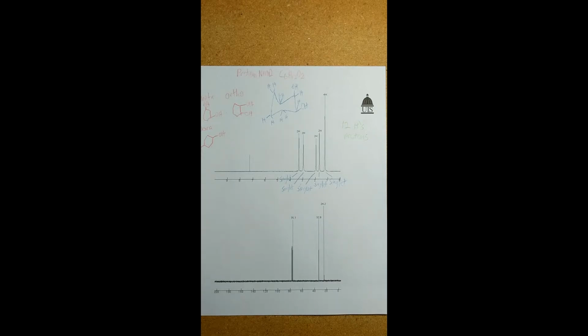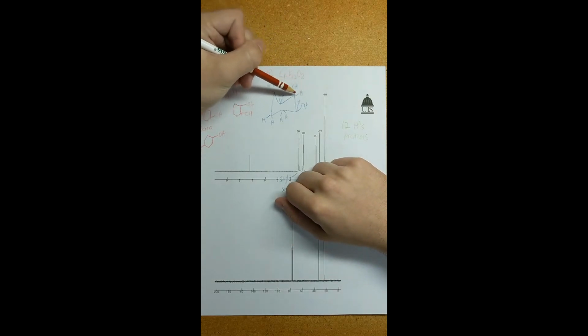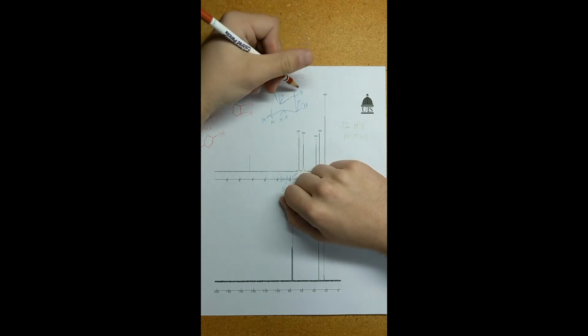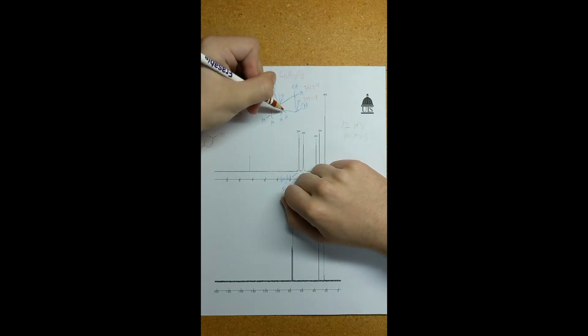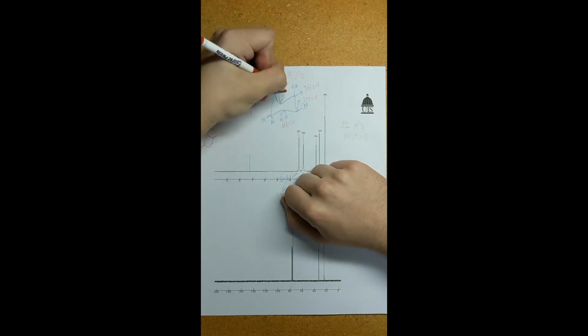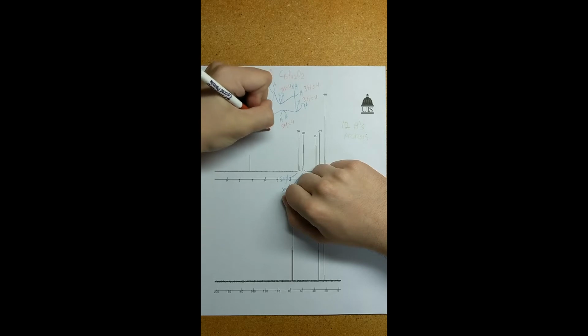So now that we have this, we're going to move on to the N+1 rule like I mentioned, in the hopes that it will help us line up with these integrations. It may not, but we will see. And to do that, referencing a proton, one looks at the adjacent carbons and its protons and takes that number +1. So for these two, they are both going to have an N+1 rule of 3 + 1, it's 4. Again here, 3 + 1 = 4. These two groups are going to be the same as well. And these two groups are actually going to be 4 + 1, which = 5, of course.